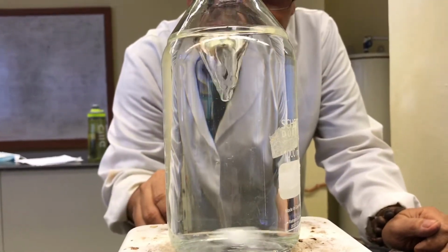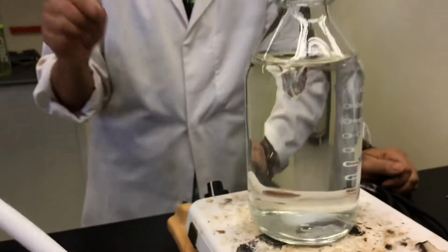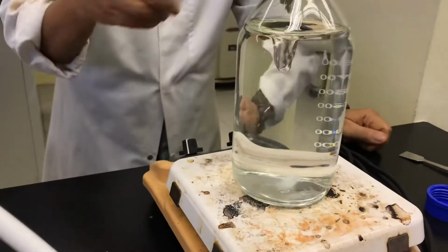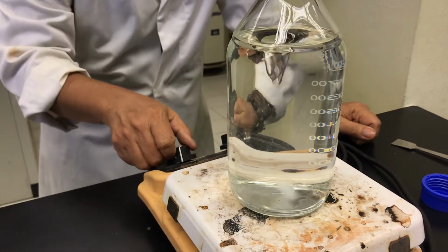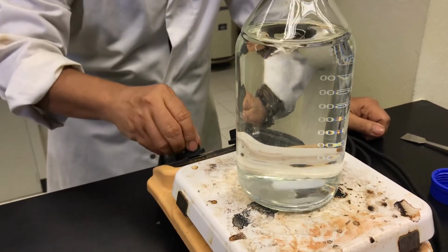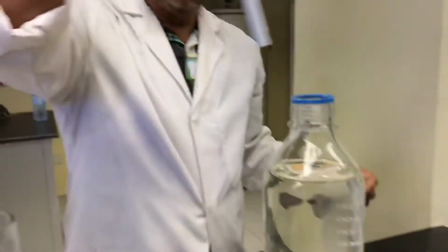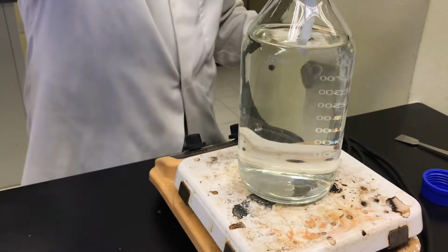Then you see the media. You don't have to heat unless the media says you must heat. If the label says you must heat, then heat, but usually you don't need to heat while you are stirring. So turn off the stirrer. Okay. Then remember you have to take back your stirrer. Don't autoclave the whole thing with the stirrer.